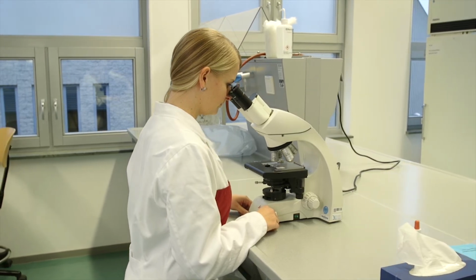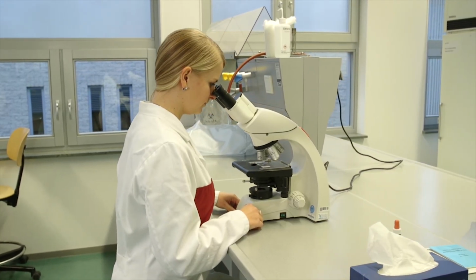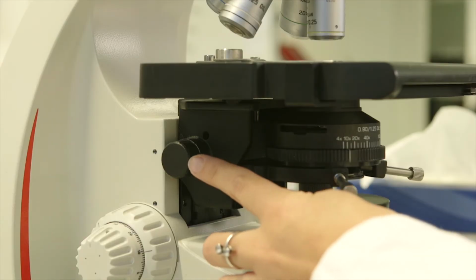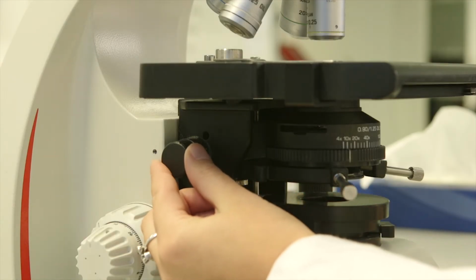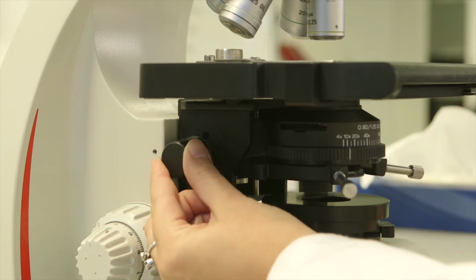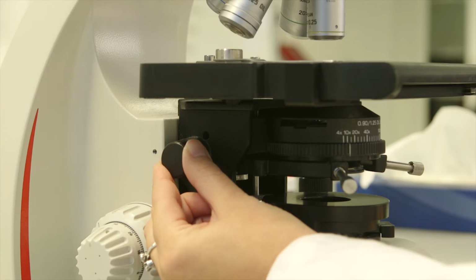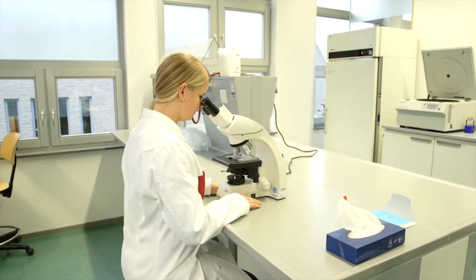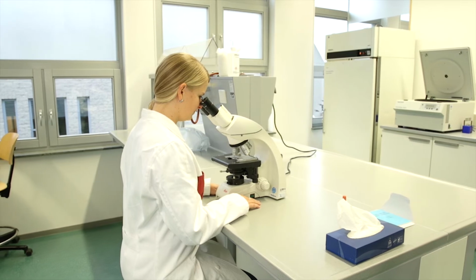The microscope is now set correctly. We now have a sharp microscopic image with the right exposure, thus revealing the many details we can observe. Importantly, these settings are optimal for stained preparations. If you are viewing an unstained preparation, you have to set the condenser lens in the lowest position in order to create more contrast. To observe more details in your section, you can increase the magnification of the microscope.